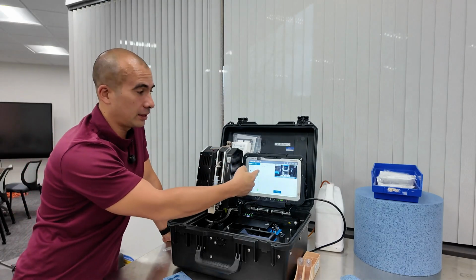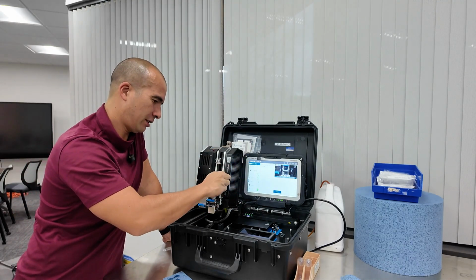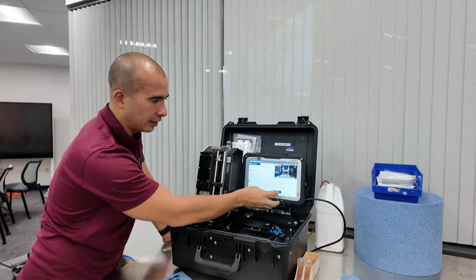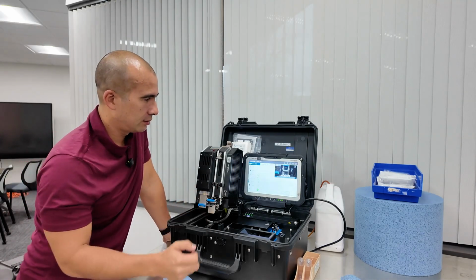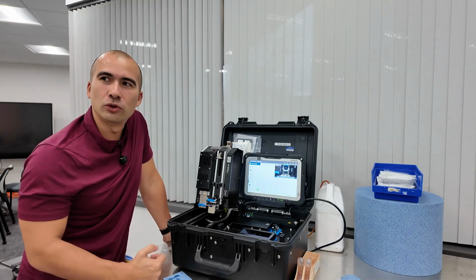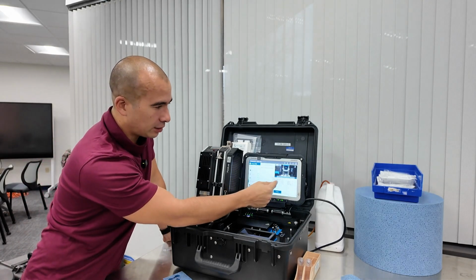All right, so now this is telling us we can remove the syringe, because that's all done. So I'll place that over there. Hit the continue button. It's just going to close that, and it does a drying cycle. All right, so now that's given us a particle count here.